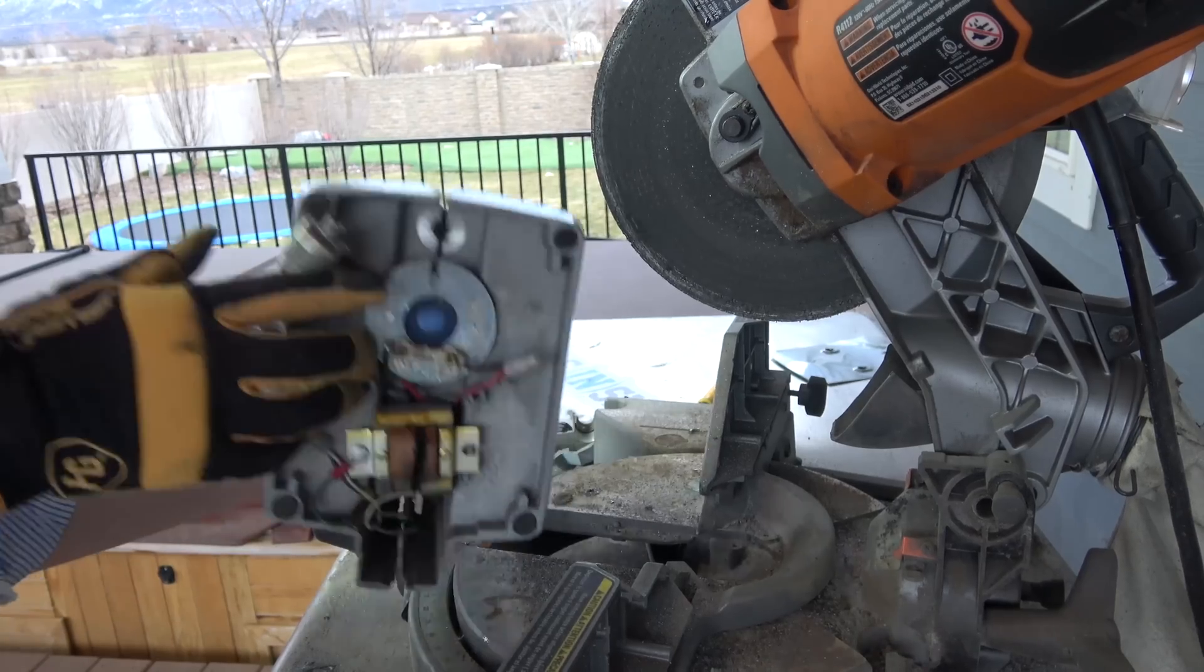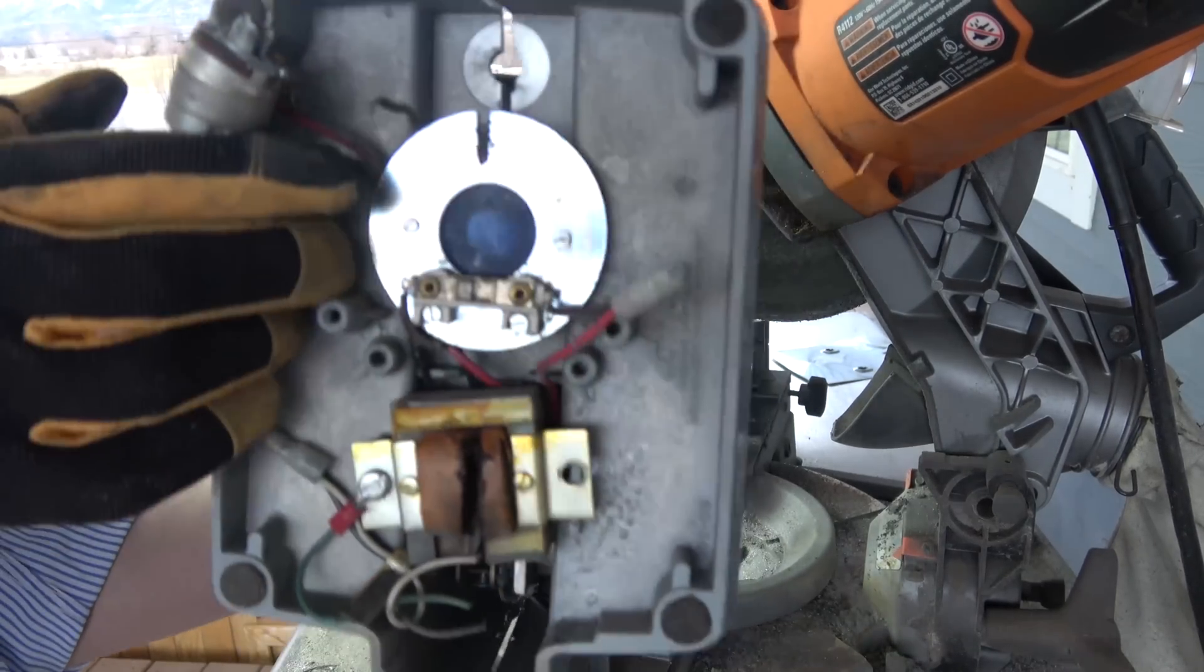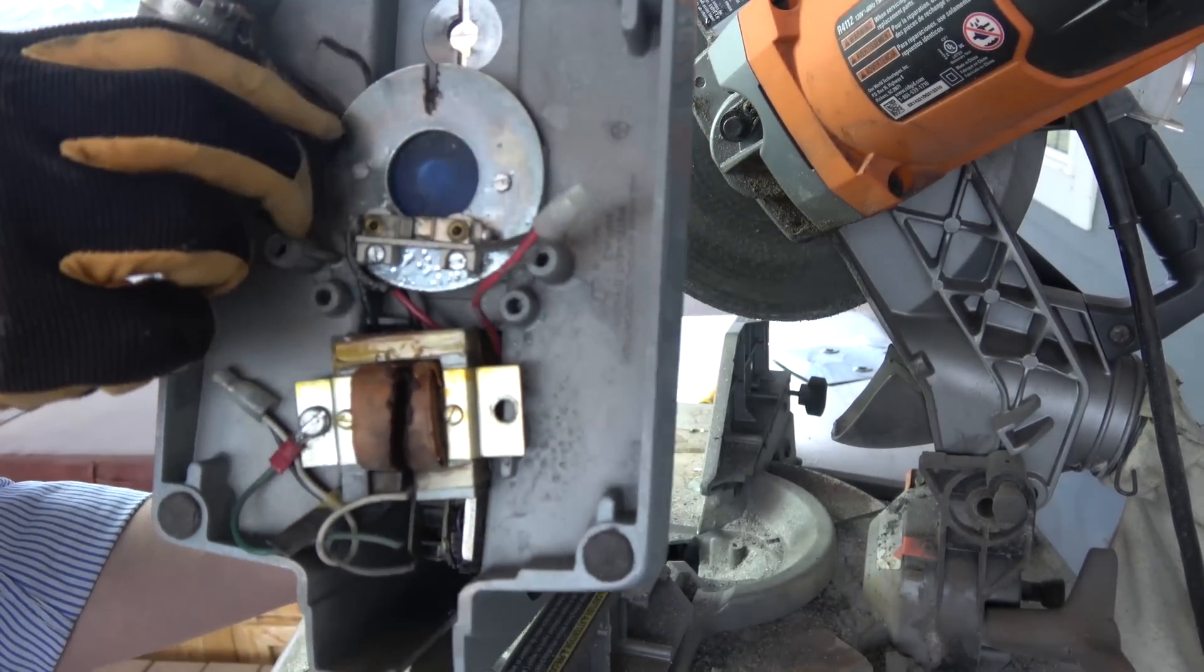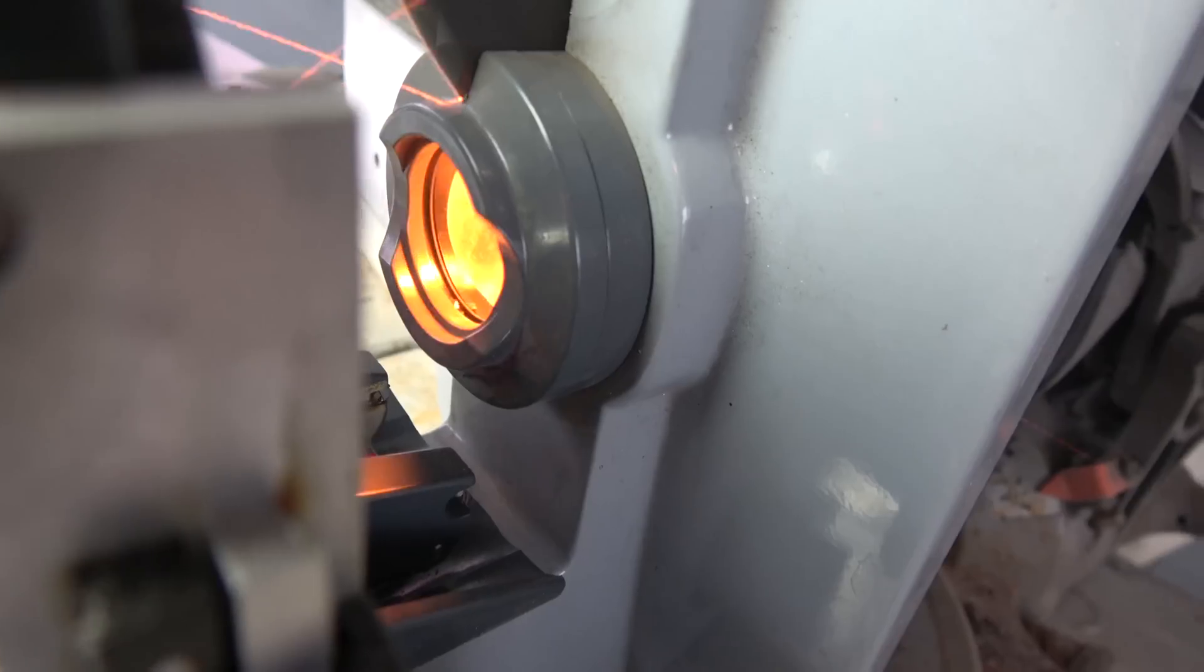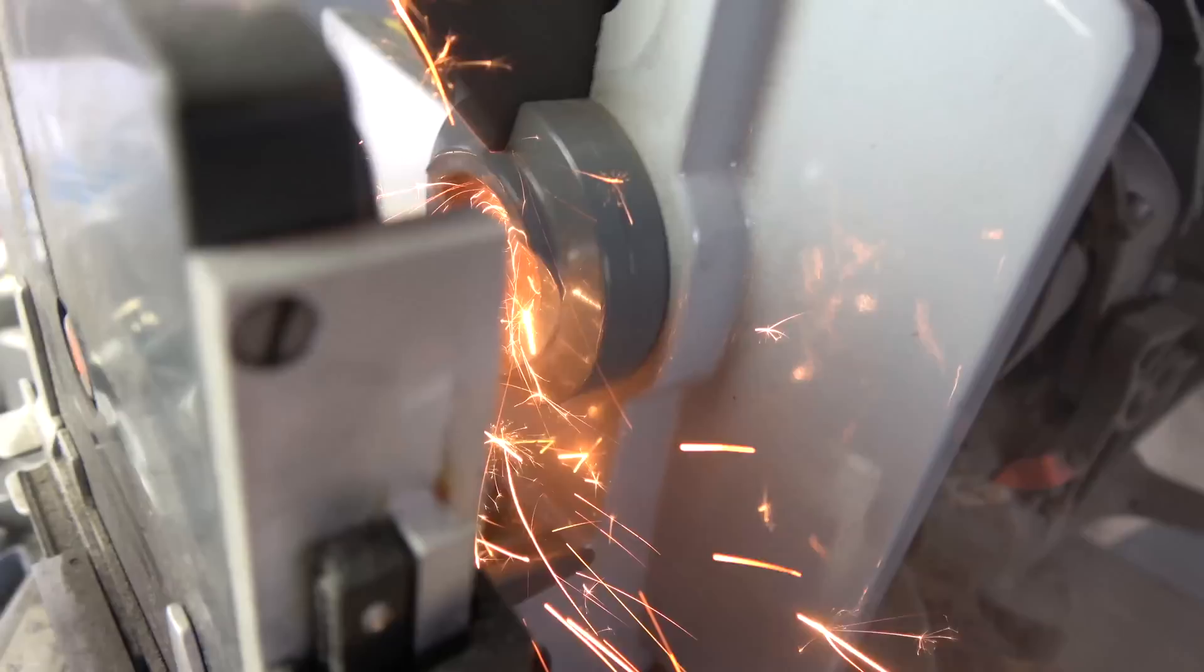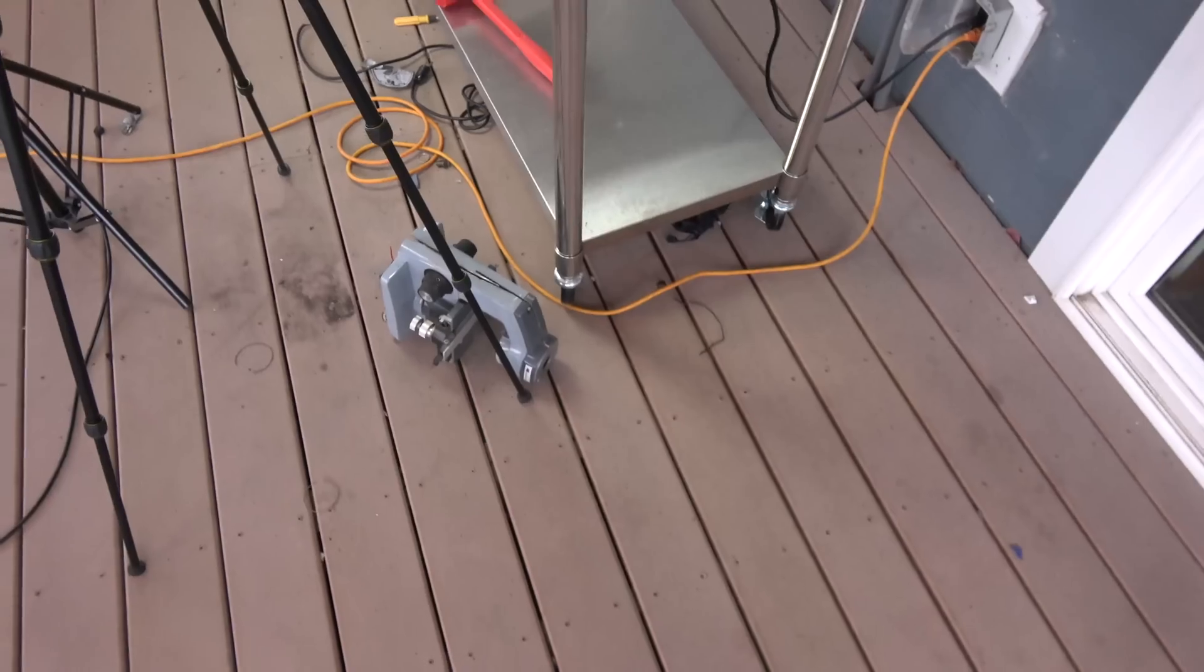We just got into where the actual light goes through it, right there with the blue thing. It's pretty heavy. You can do it, Blade. Microscope down. Microscope down.